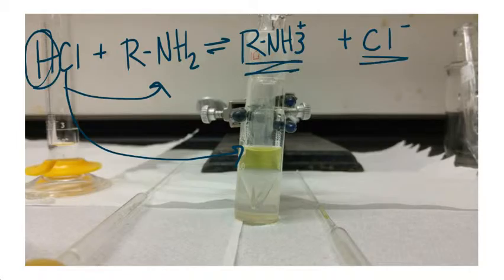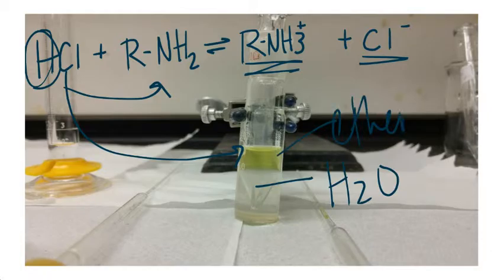When we do this, we get an aqueous layer that has water from the neutralization process and an ether layer that forms on top. The ether layer forms on top because it is nonpolar and the water layer is polar, and they do not like to mix. The ether layer is also less dense, so it floats on top of the water.